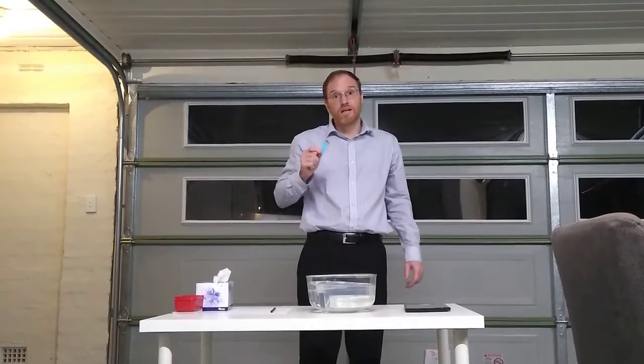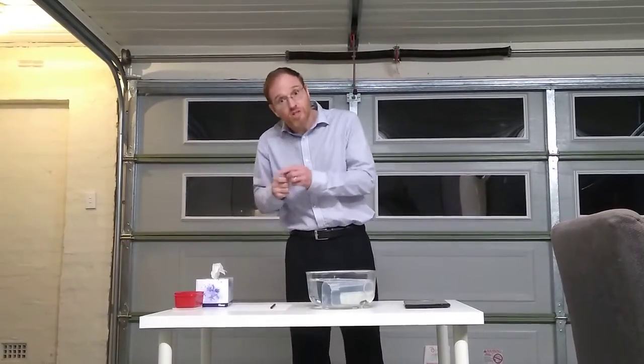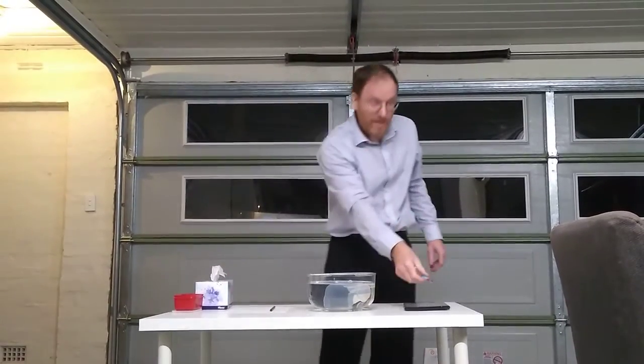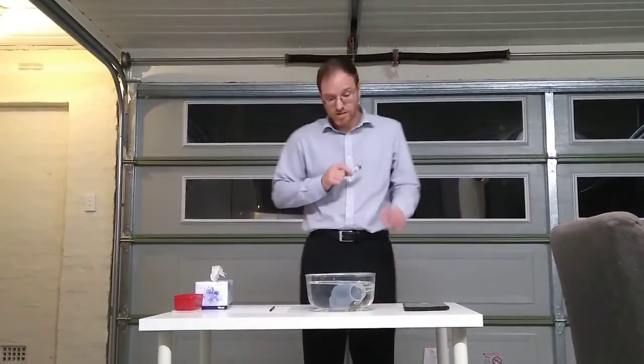Then I'm going to weigh my cigarette lighter again. Now the problem is it's wet and that will mess it up. So I would dry it as much as I can, shake it, sit it down, leave it to dry, maybe leave it overnight or something. Then measure the weight again. And the difference is the mass of the butane gas. So I've got the mass of the butane gas that I've released. I've got the volume, and I can calculate the molar mass of the butane.